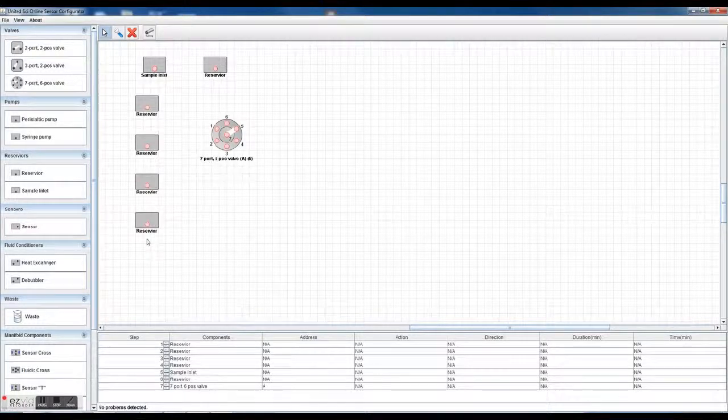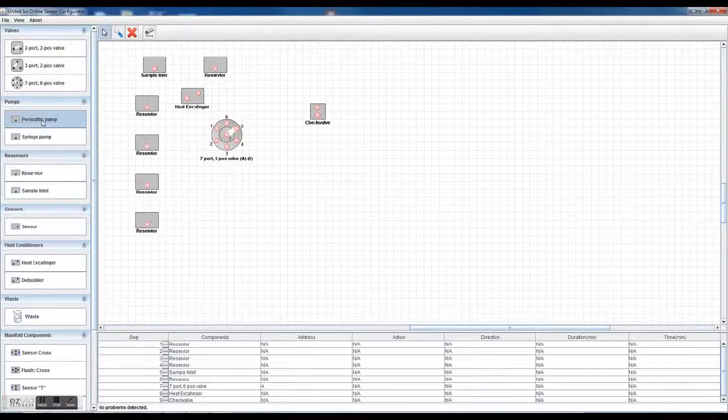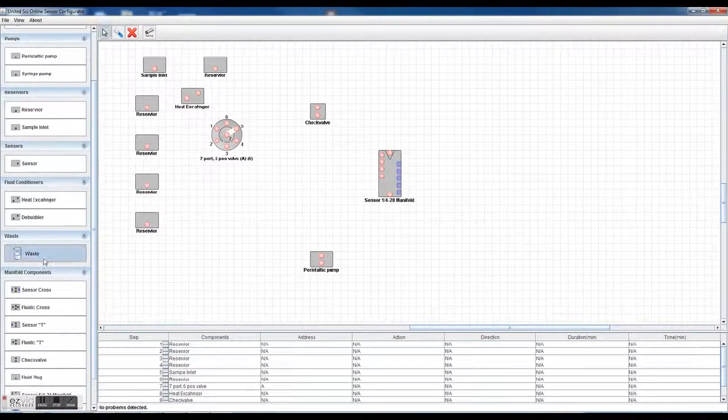You probably also want to have some sort of heat exchanger, depending on if the water is coming in very hot from the sample. You can put a heat exchanger in, and maybe a check valve here for the outlets, along with some sort of pump here to pull it all through. And then of course you're going to want to select your sensor system. Sensor system here is a 1/4-28 manifold. I'm just selecting a standard one. And of course a waste container, maybe that's a peristaltic pump.